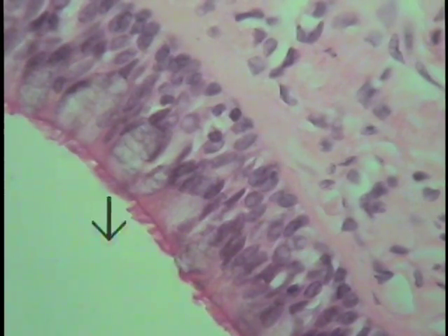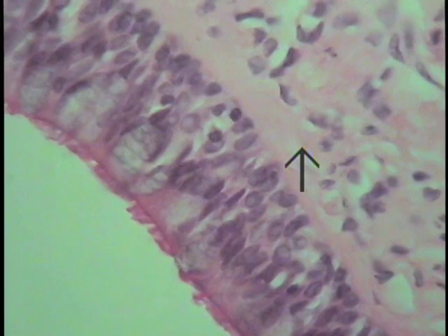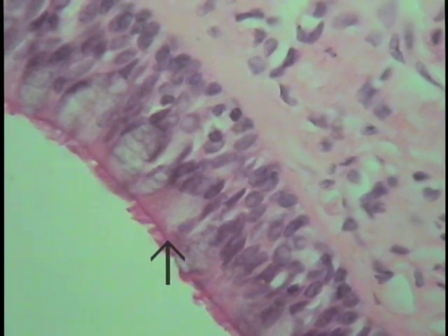The reason this epithelium looks a little bit worse for wear is because this is a typical paraffin section rather than some of the crisp plastic sections that are used and observed in other tissues elsewhere. So it looks a little bit thick and is muddy in nature. If we look along its surface, you can see melded together, sort of clumped together, these little projections here are cilia. And cilia are typically found within the respiratory tree, obviously for functional reasons.